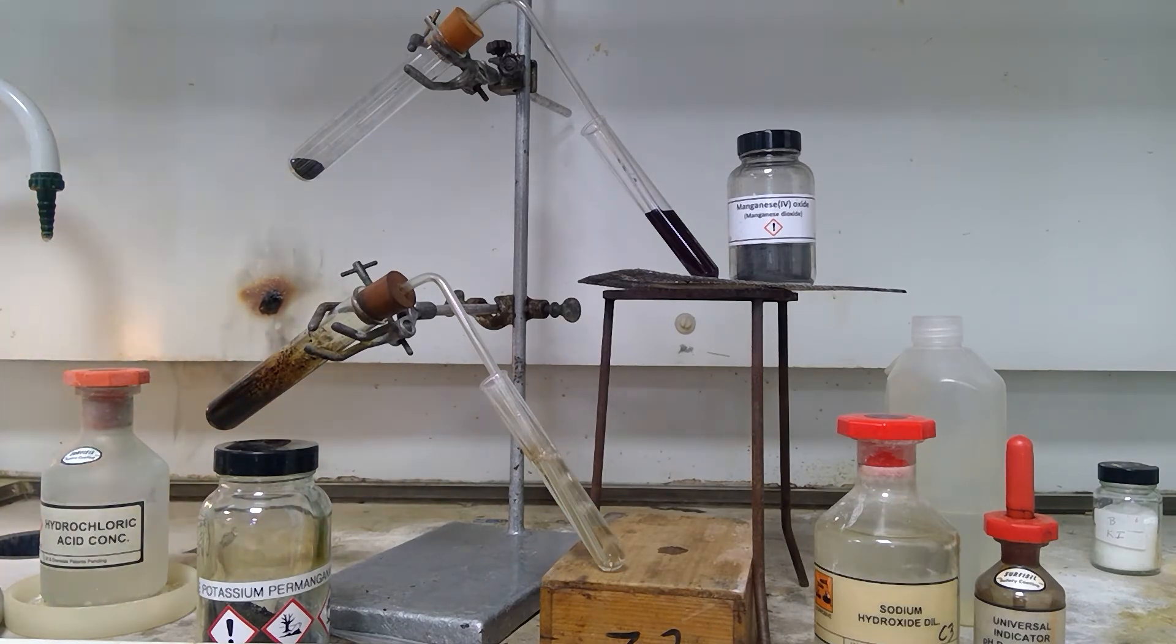Perhaps no great sign of any pink colors. In fact, the color of the indicator has disappeared. It has been bleached. A rapid production of the gas chlorine.